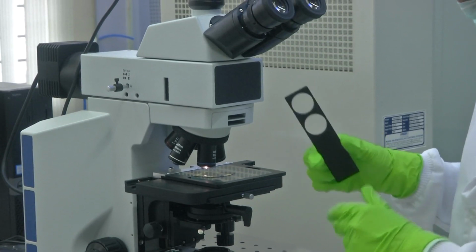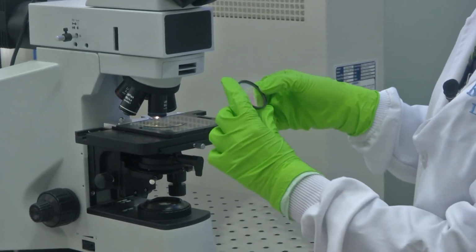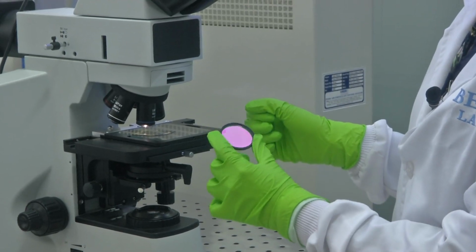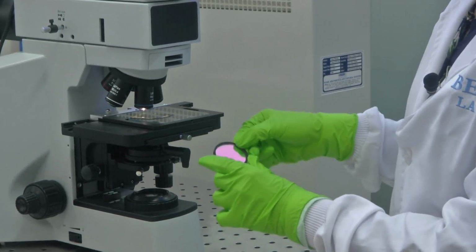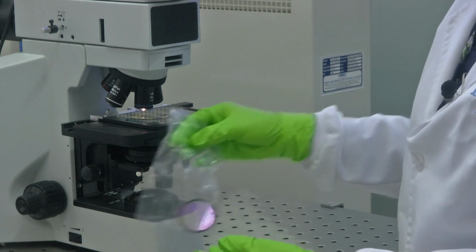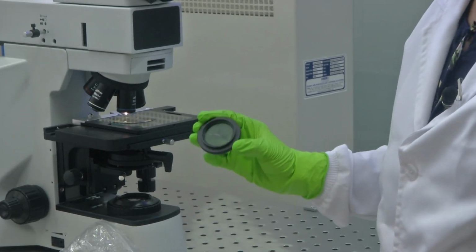So, let us see the other which can be used along with this. This can be integrated. So, this is one such lens. It is more bluish in order to filter light of one particular wavelength. You could use these type of lens based on the application, based on the requirements. This again goes on the light source which is at the bottom.